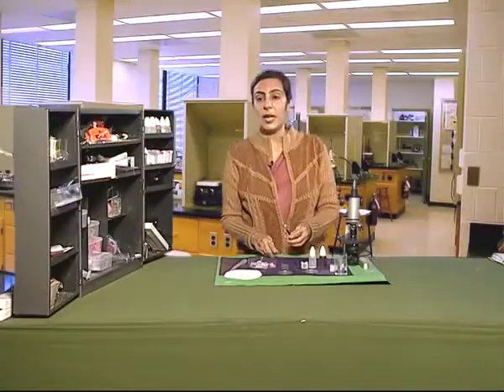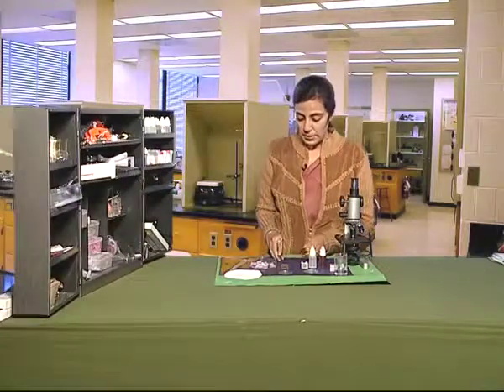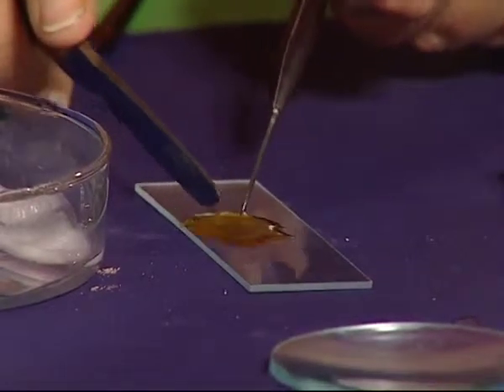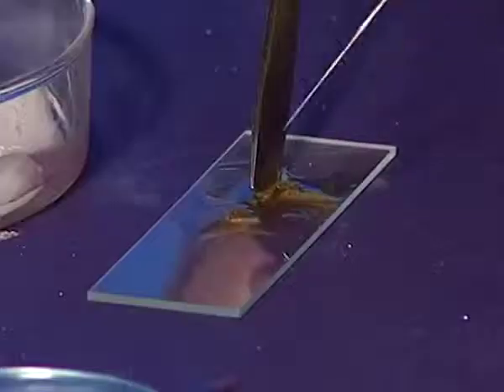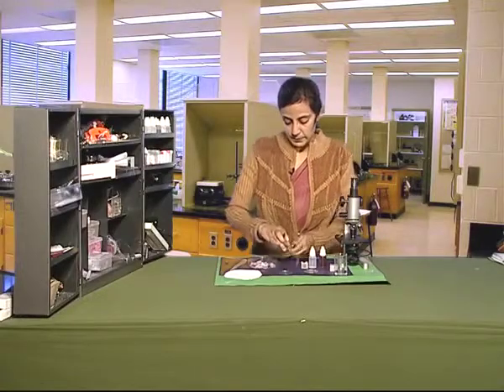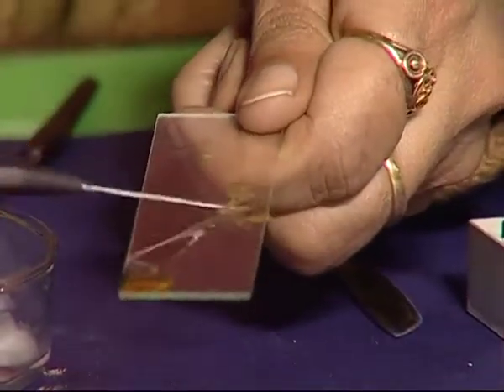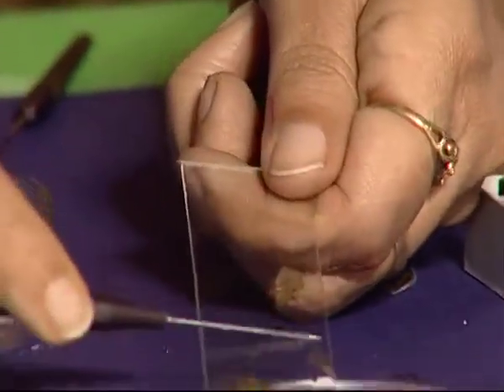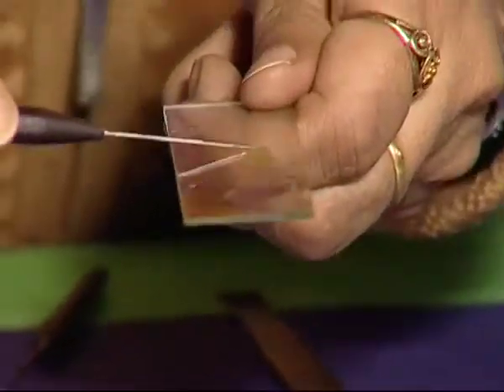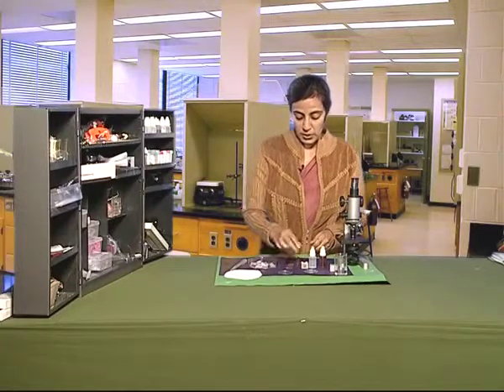With the help of a razor, cut the peel into a small part. Now, add one or two drops of glycerin to it.